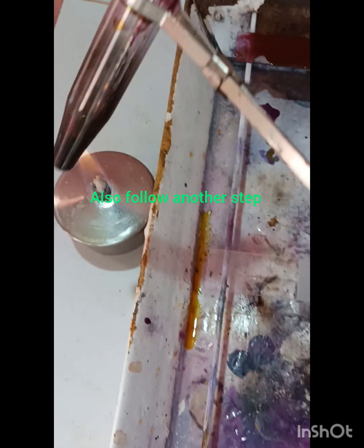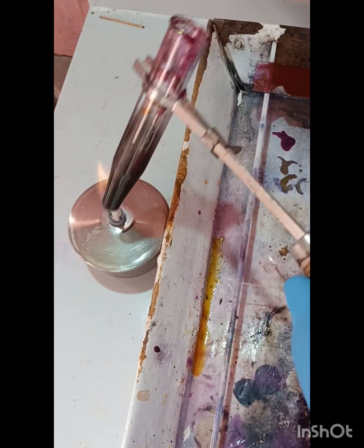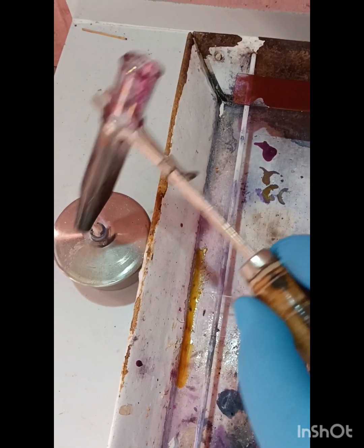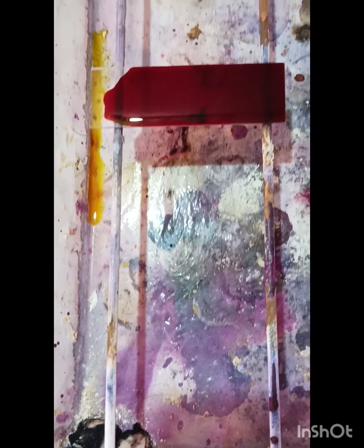Similarly, we can take a test tube with carbol fuchsin and heat it gently, and remember that when vapor arises from the test tube, at that time we can put it over the smear.